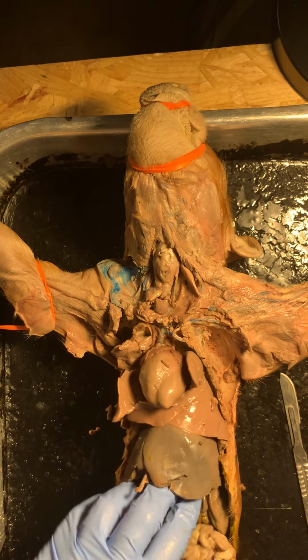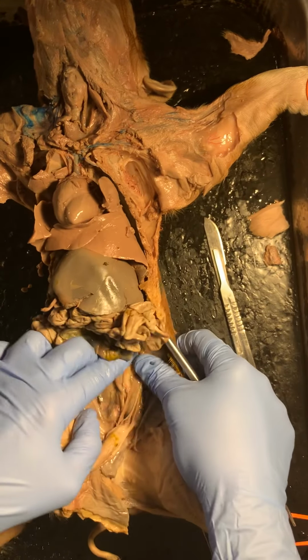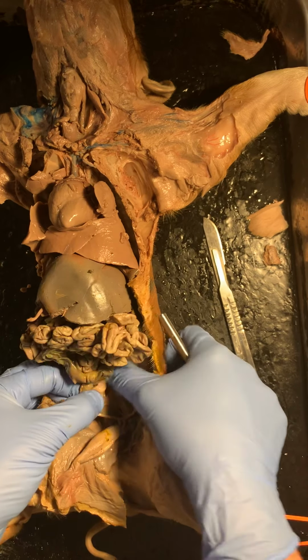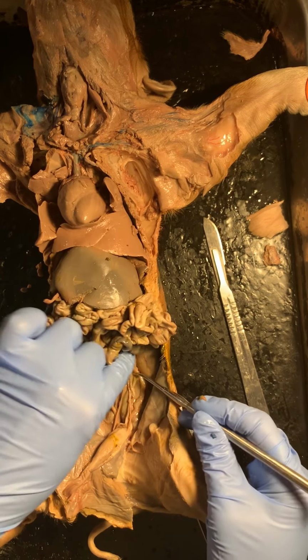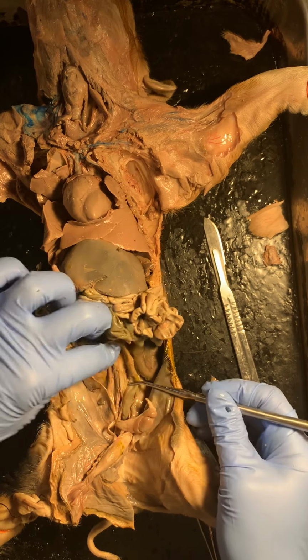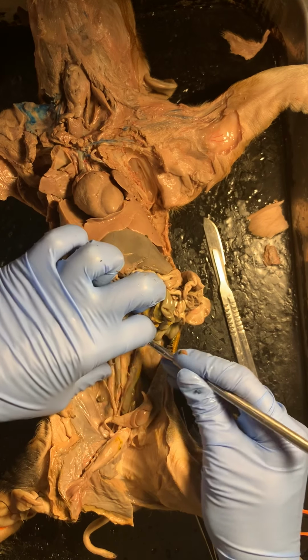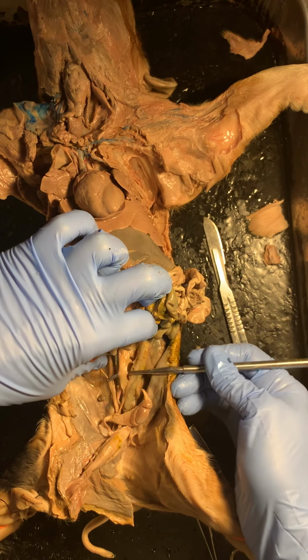As we get down into the pelvic region, here, and we get down to here, we had seen the rectum, which was the end of the large intestines right here, but I had also gone through two other blood vessels. You have the aorta again. This would be the abdominal aorta.